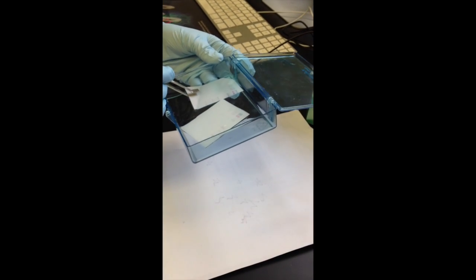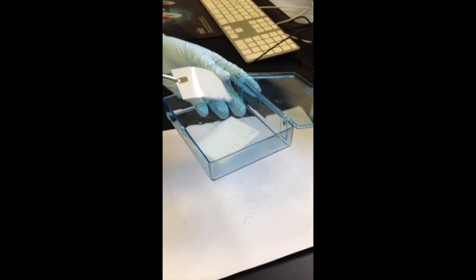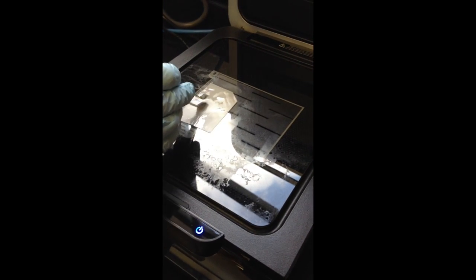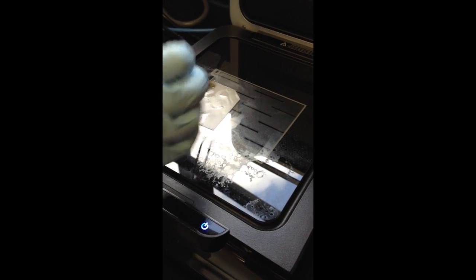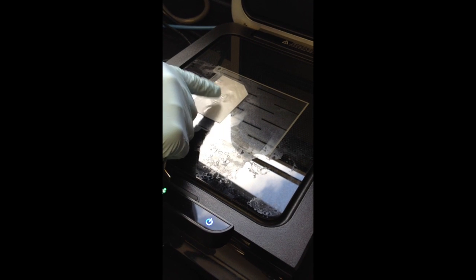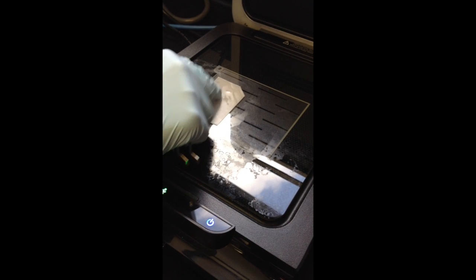And you have to make sure to keep the protein side face down on the scanner, and you don't want bubbles because that will prevent your blot from scanning properly.